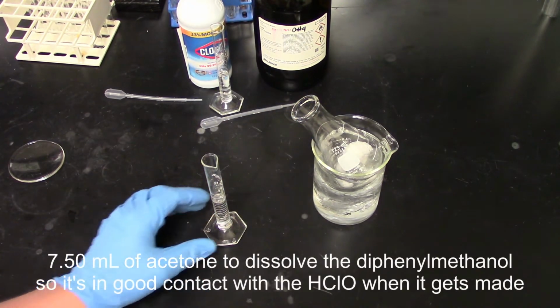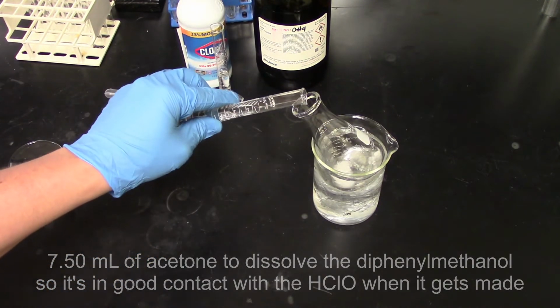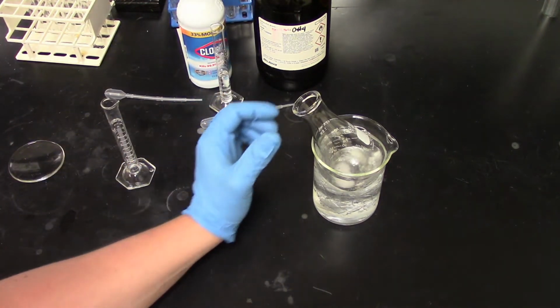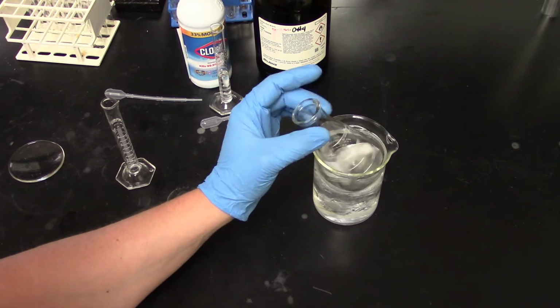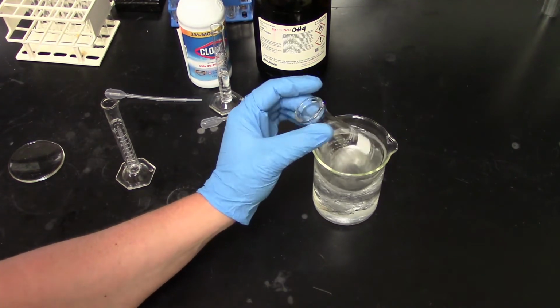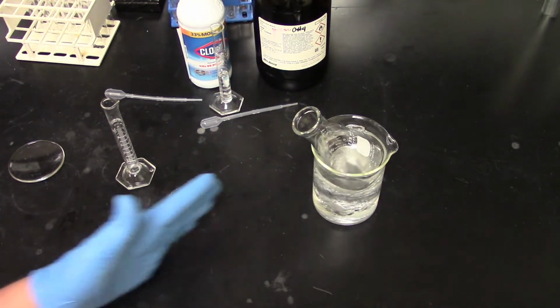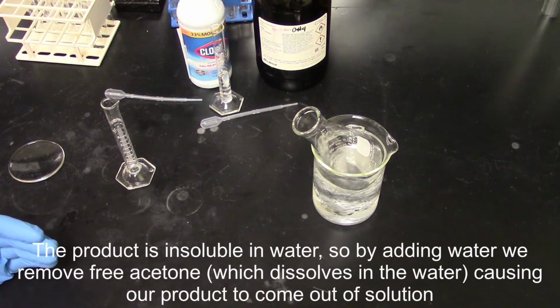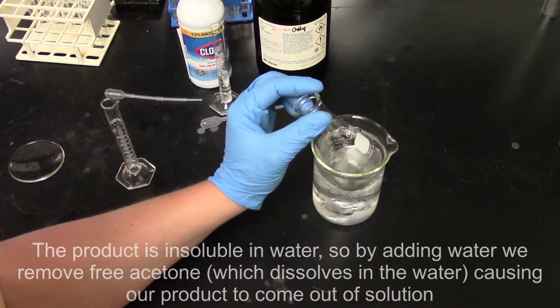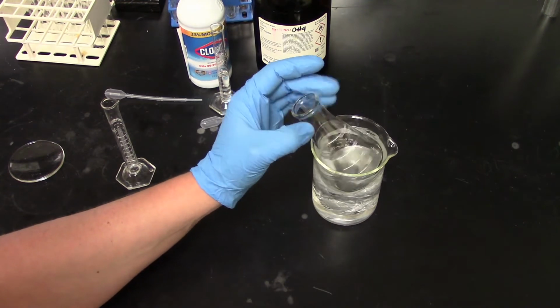What the acetone does here is it solubilizes the diphenylmethanol, so it'll actually stay in contact with the hypochlorous acid that we're going to end up generating in situ next. We're not going to get this completely dissolved, but we are going to get it mostly dissolved. The nice thing is acetone is pretty soluble in water, so when we go to extract our product, we can start adding water, and our product and certain reagents are not soluble in water. As we add water to this acetone mixture, we decrease the solubility of our product and our starting reagent.